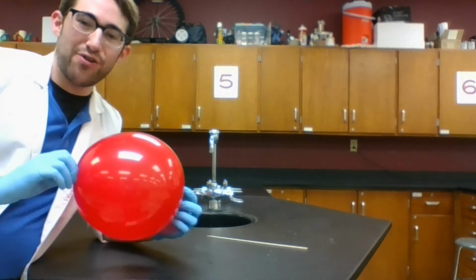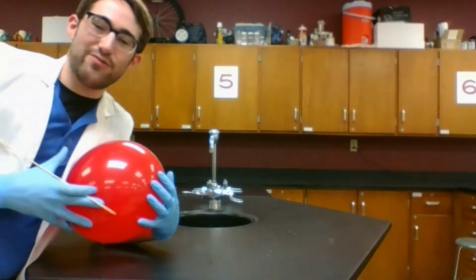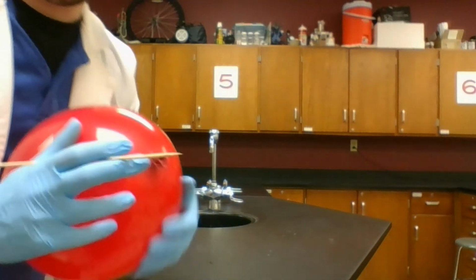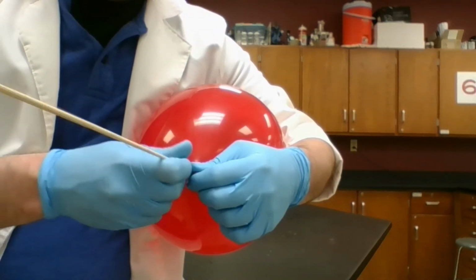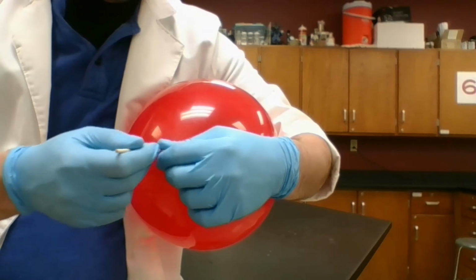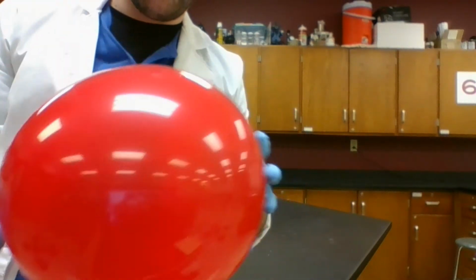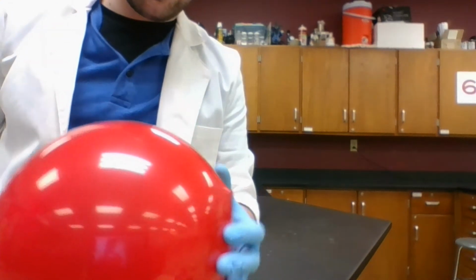Okay, now we all know, probably just by personal experience, what it's like when a balloon pops. So I've got a very pointy stick. Just point that in there. Oh, well, you guys have probably already seen a balloon pop before, so that'd be kind of boring to show you. So maybe I'll do something a little bit different.